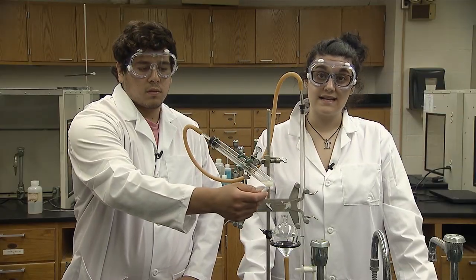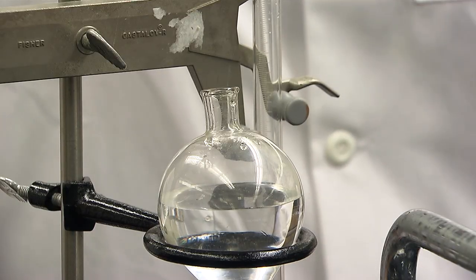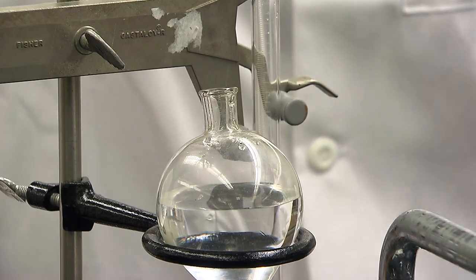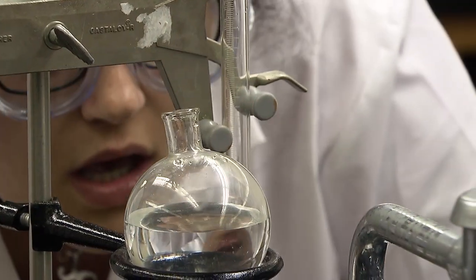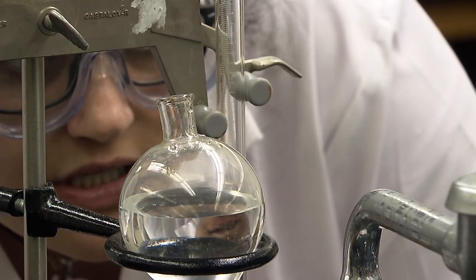The water level hasn't changed in a while, so it looks like the reaction has finished. To make sure that the pressure inside the burette is equal to the atmospheric pressure, we have to keep the water levels the same. Adjust the bulb water level to align with the burette water level, then take the final burette reading. I read 28.00 milliliters.